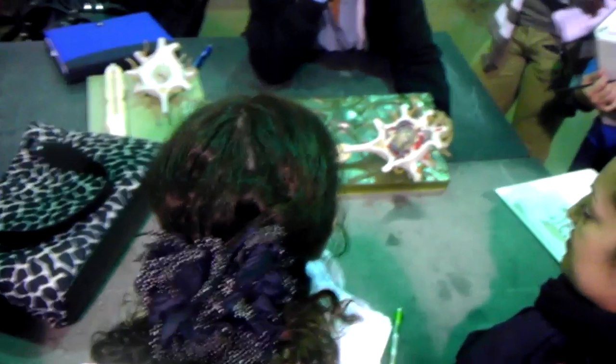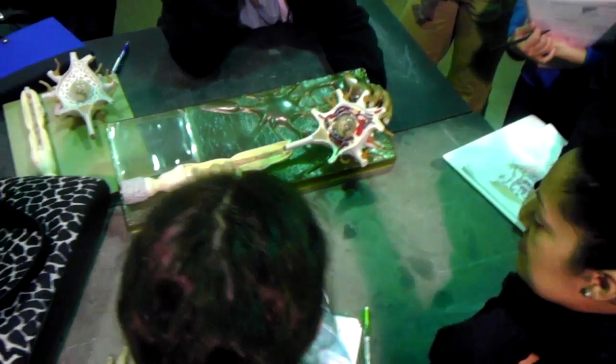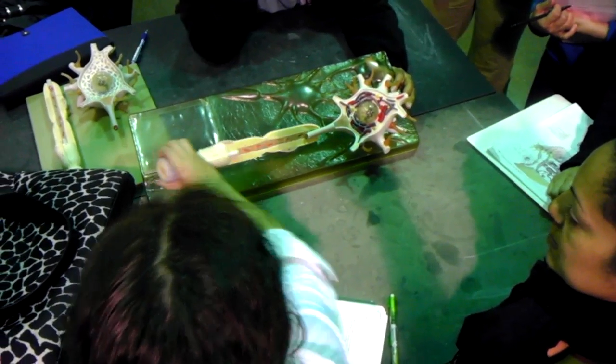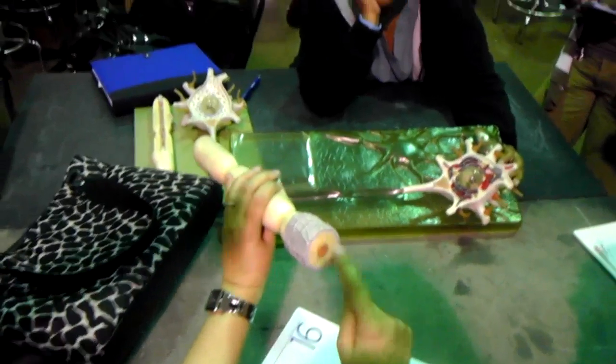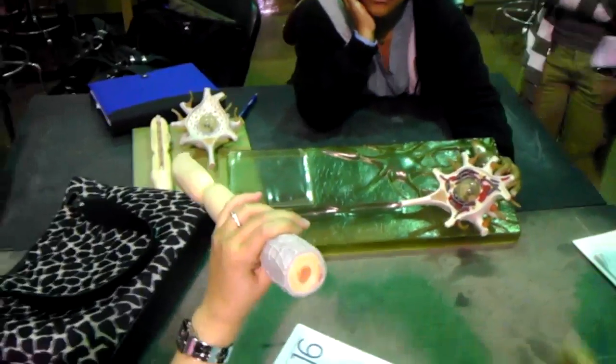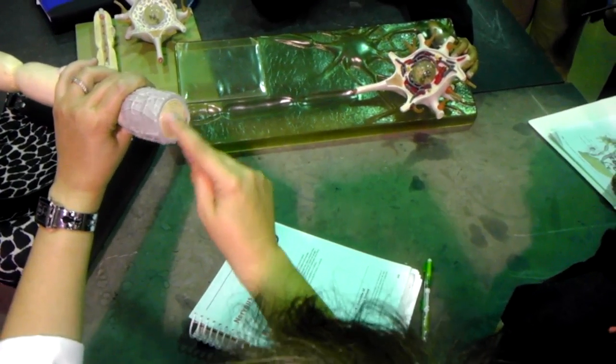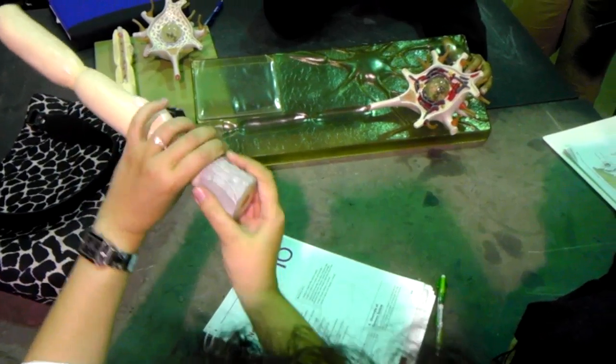This is the axon all the way inside. These are mitochondria, don't worry about them. This is the myelin sheath around it, right? And here you can see the cross section of the axon. This is the cross section, and this is the myelin sheath. Exactly like what you had in the slide. Do you remember the dark dot and the white thing? This is the same thing. This is the axon, this is the myelin sheath around it, and this is the nucleus of the Schwann cell. That's all you need to know.